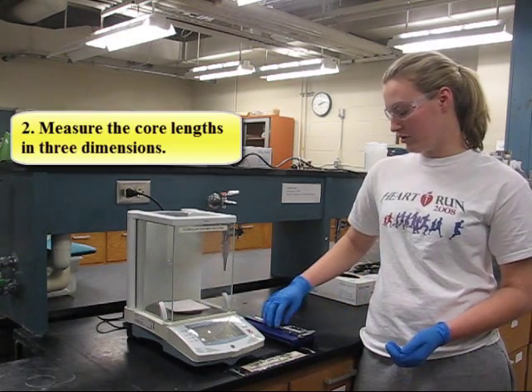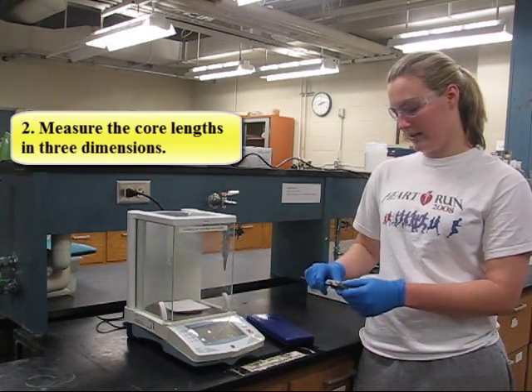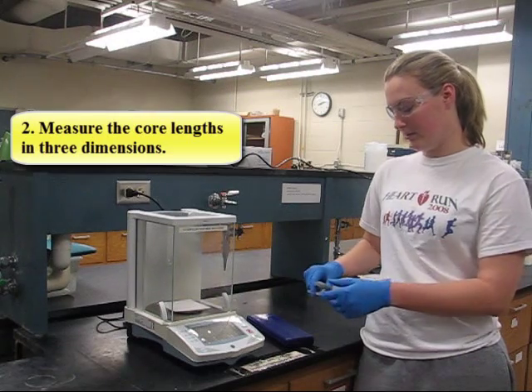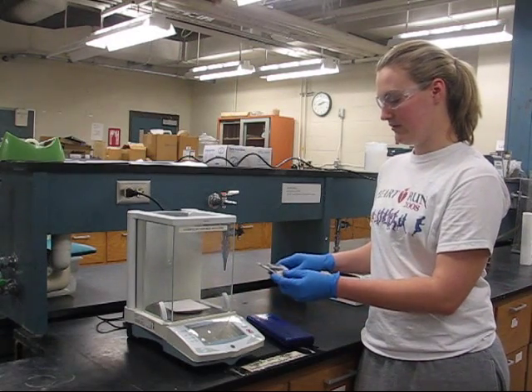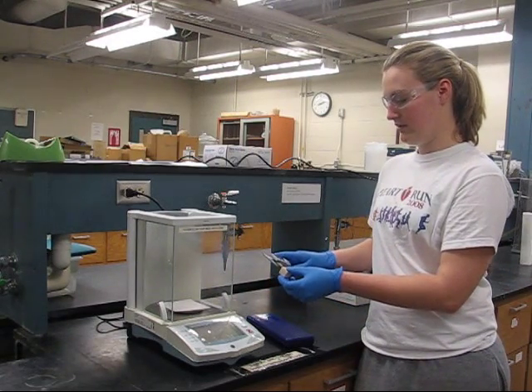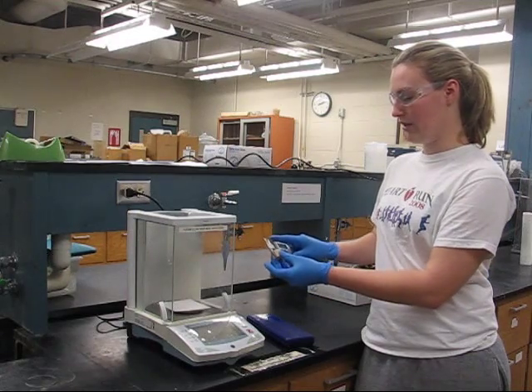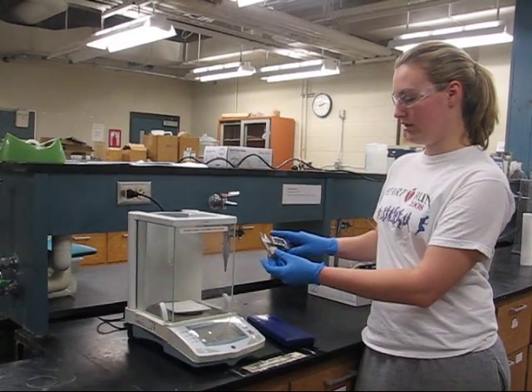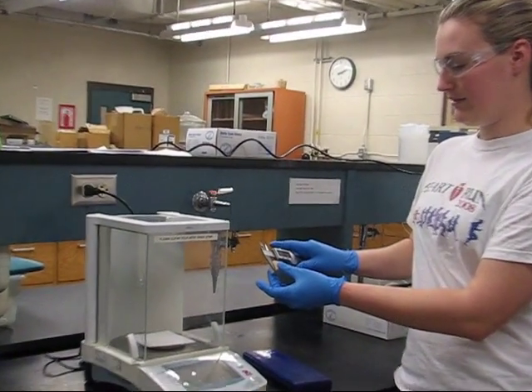First, we're going to read and record the temperature in the laboratory. Then we're going to measure all three sides of the core length using these calipers — measure sides opposite to each other and record these measurements.